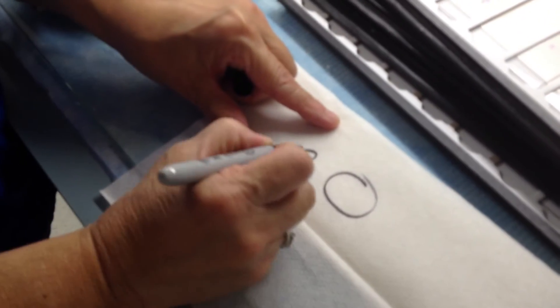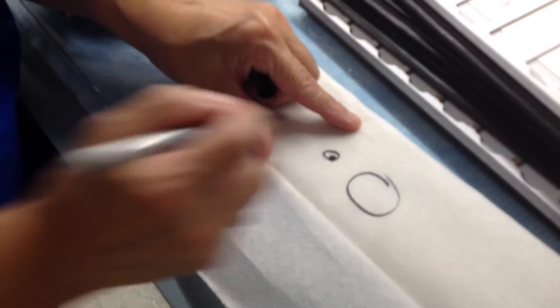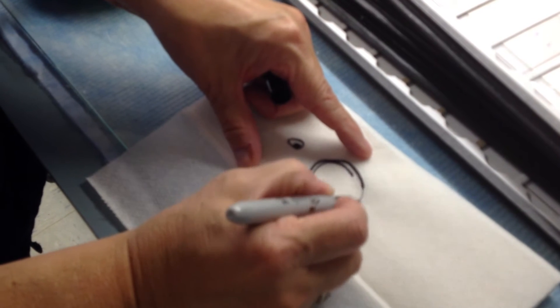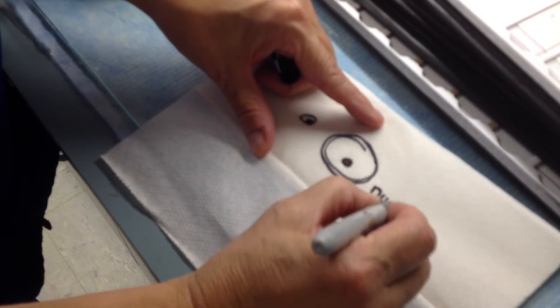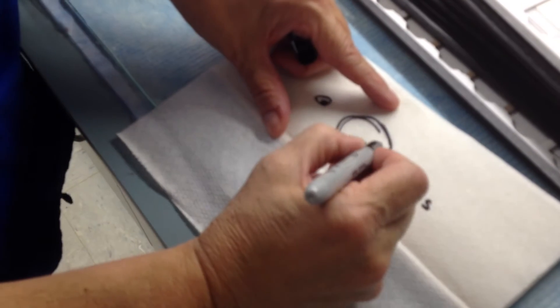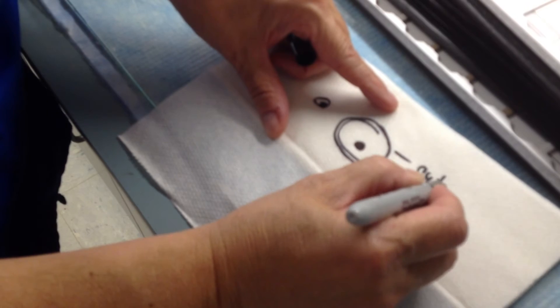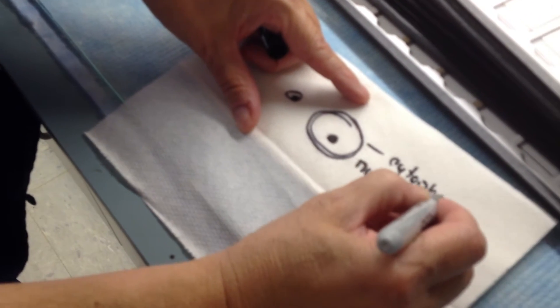I'll draw it out. Everything you see there is light pink, and then purple. So if you take this and make it bigger — the purple is the nucleus of the cell, and all the other stuff is the cytoplasm.